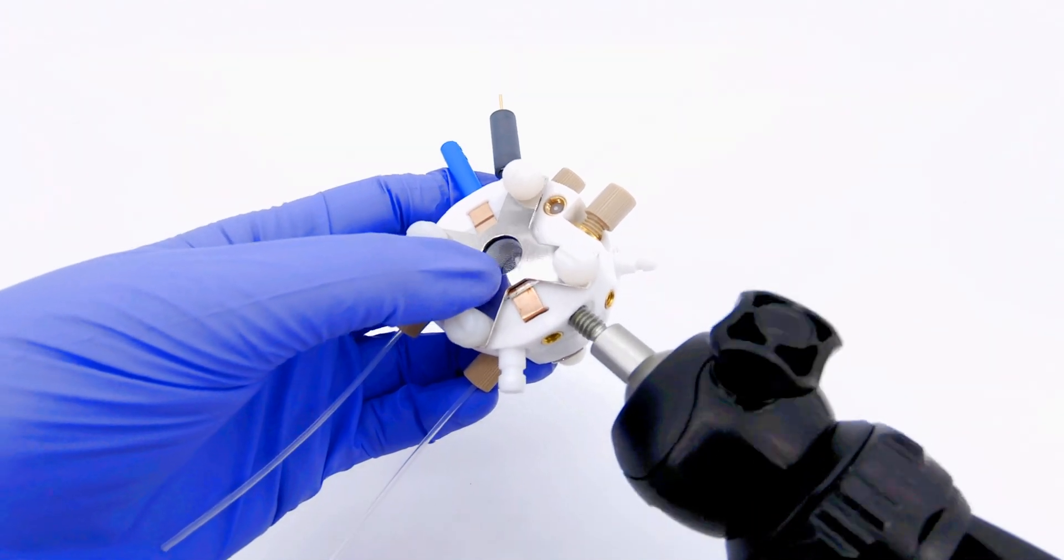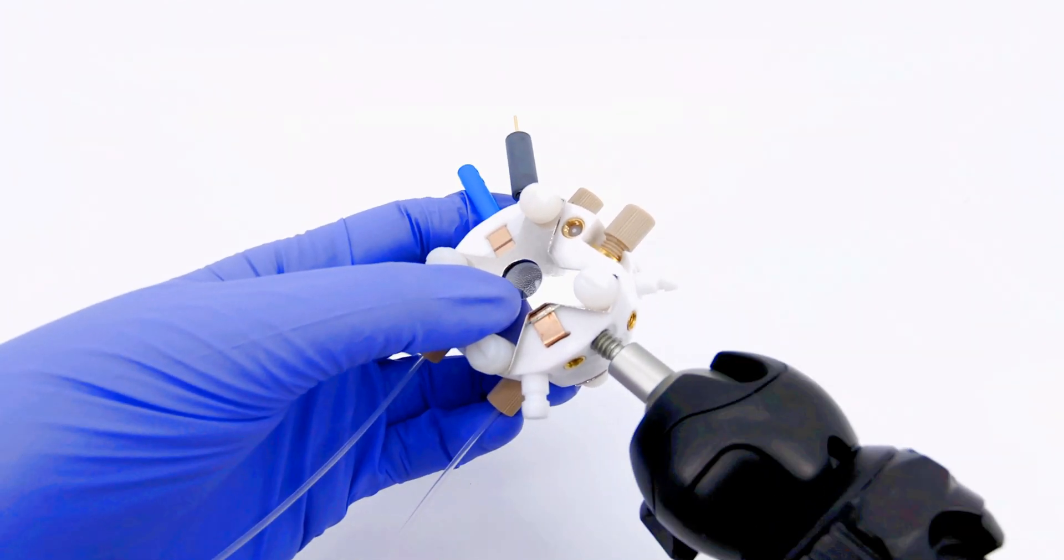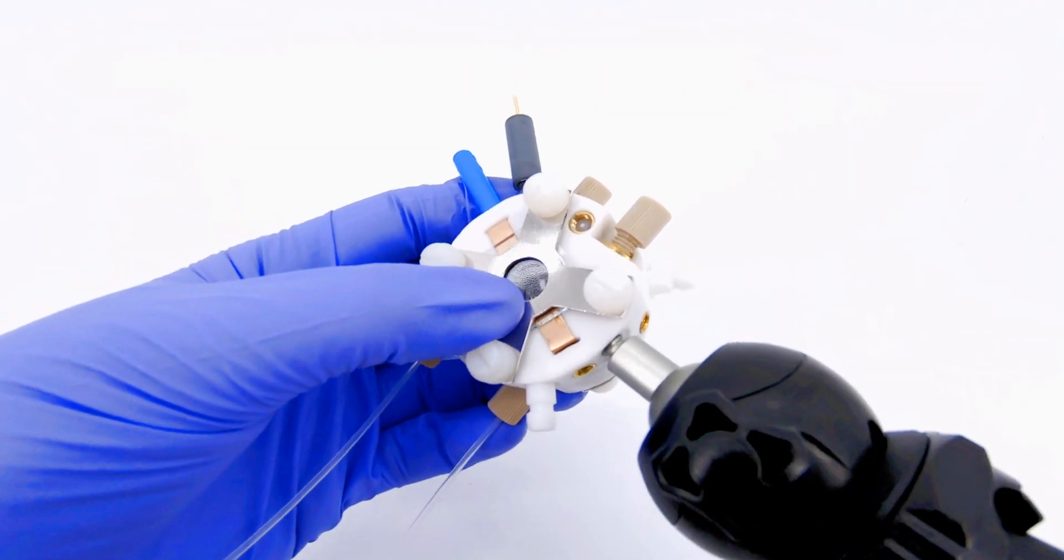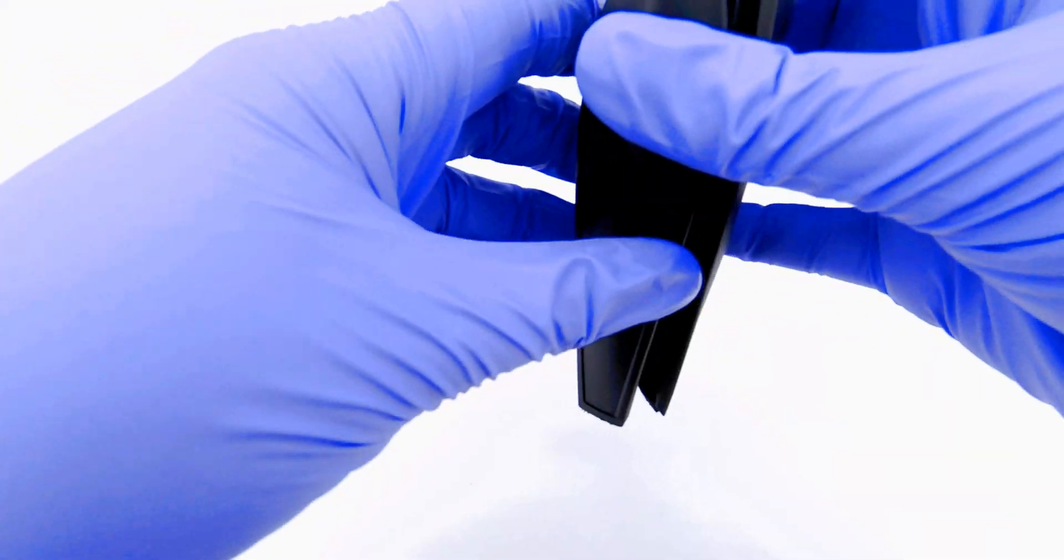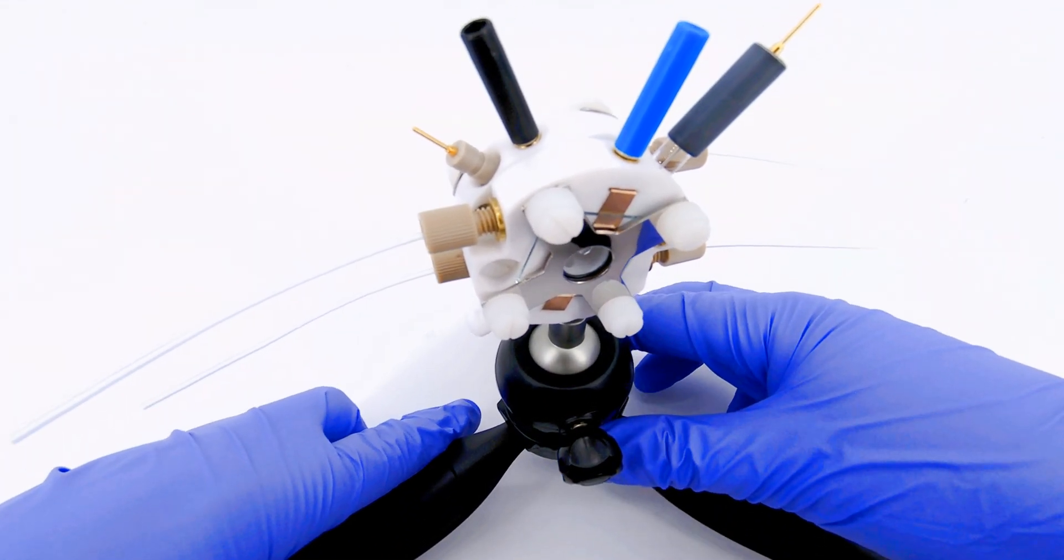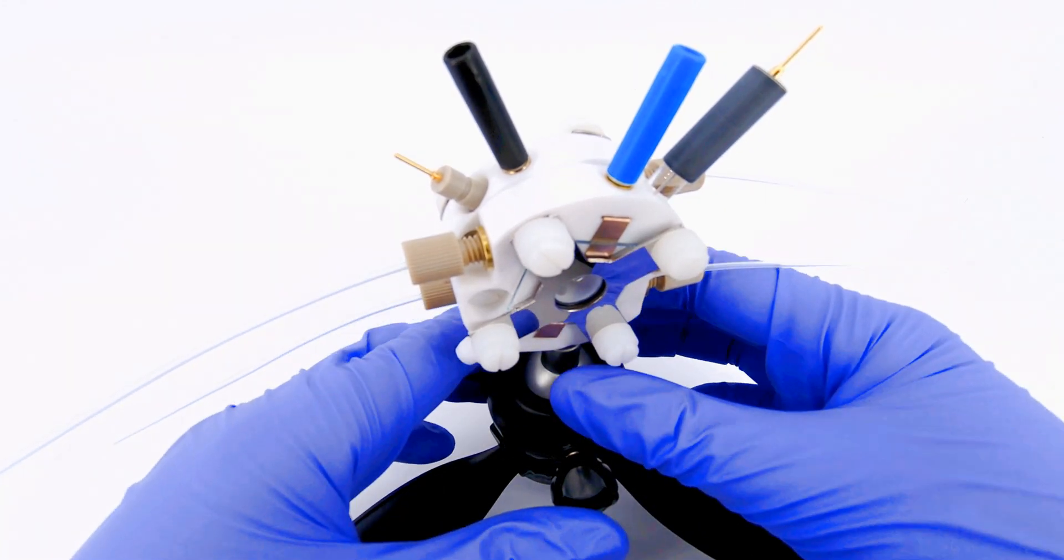Finally, screw the tripod into the cell. Great job, you've finished the setup for our PTFE photo-electrochemical flow cell.